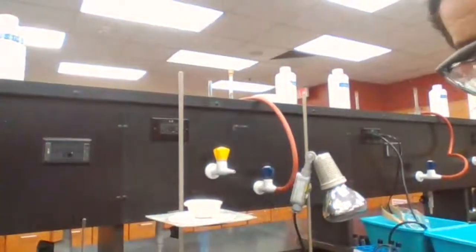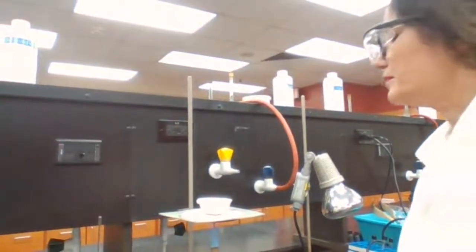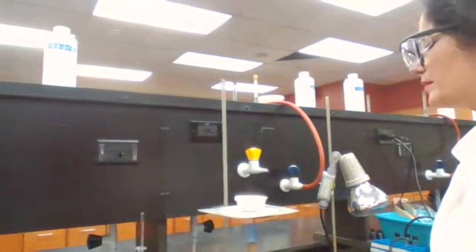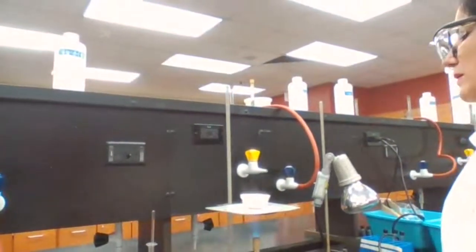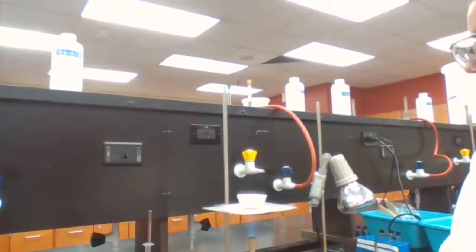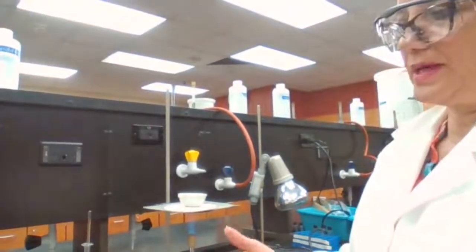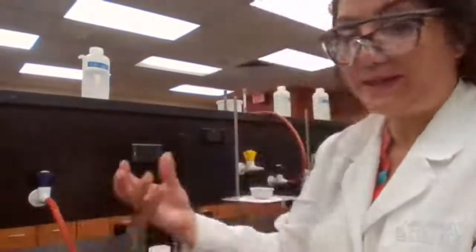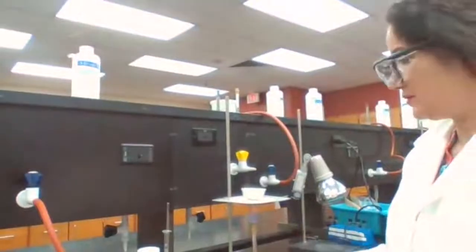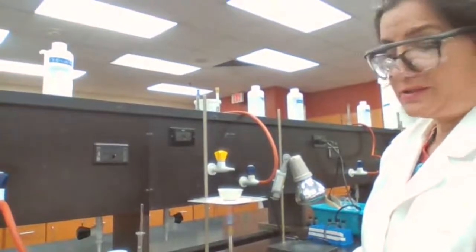Like writing a balanced equation. Like if you have zinc plus I2, what would be the product? But the part of the experiment which, I understand, as a remote learner, you are not going to be able to come to the lab to perform the experiment and collect the data. I do that part of the experiment for you, to give you the data so you don't have to be here for this time.